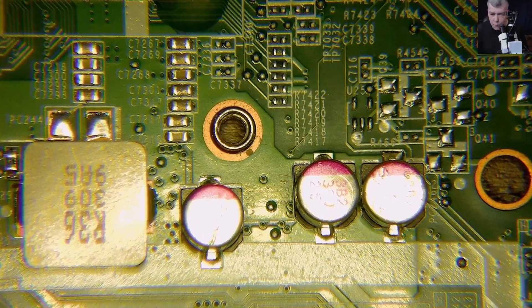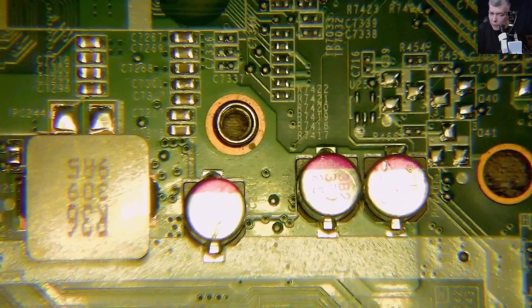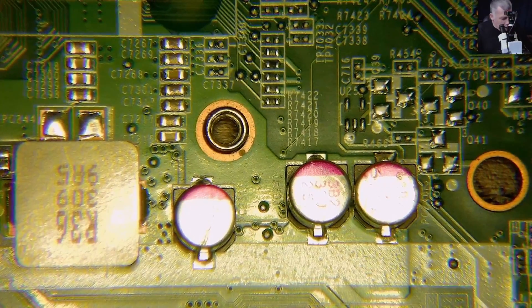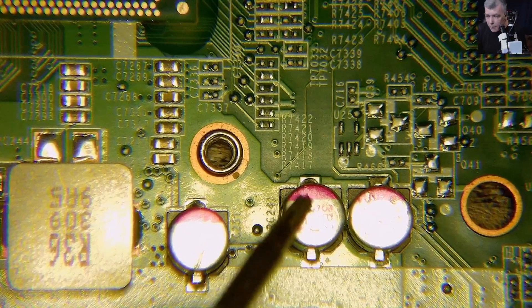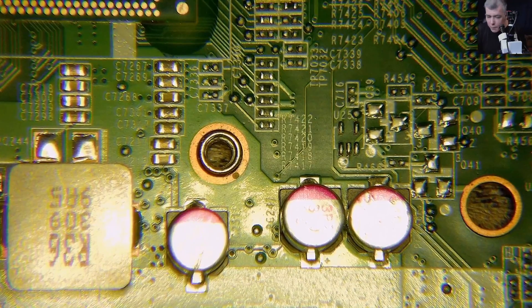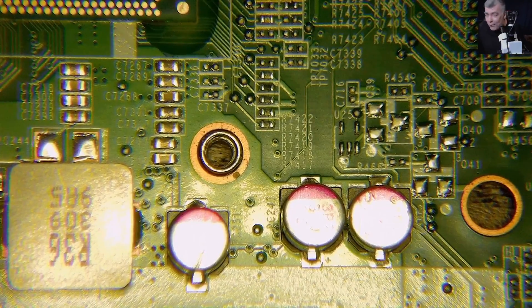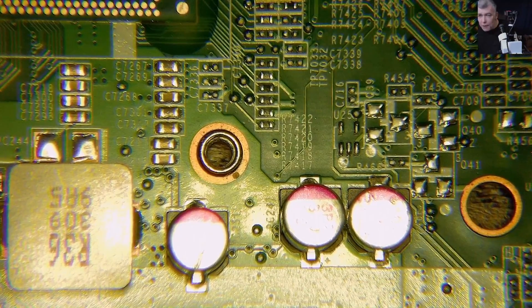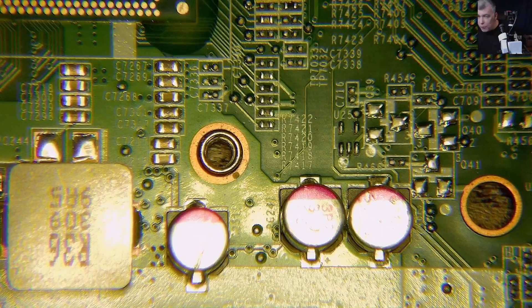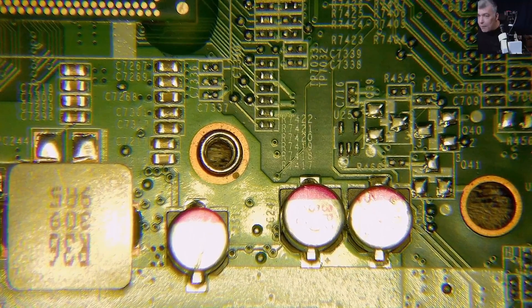Let me try to adjust this just to be sure. I'm not getting any filter, so now we have no filter. As you can see on the picture, you have three capacitors and actually you cannot see the writing on the capacitor — you can see a little bit on this one and nothing on this one. I said this is because of the camera dynamic range, yeah, because reflections are another picture. Right now we have this camera, so what we're going to do is test with a phone and test with our DSLR to see the difference, just to understand what camera dynamic range means.